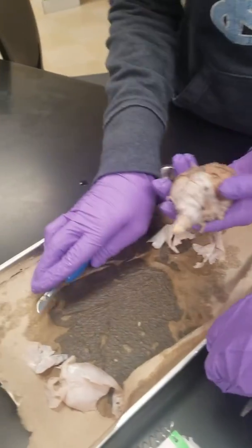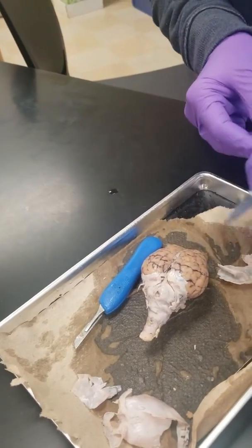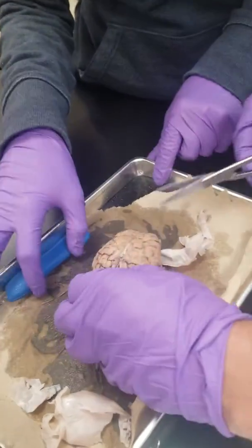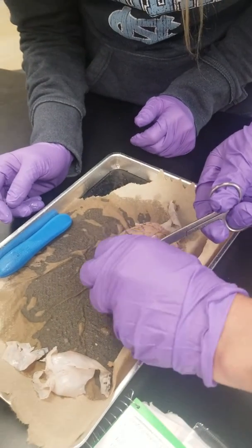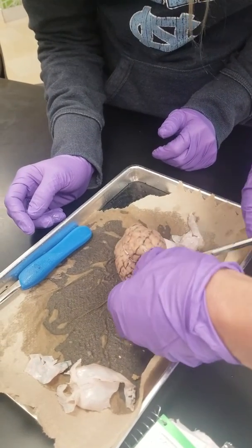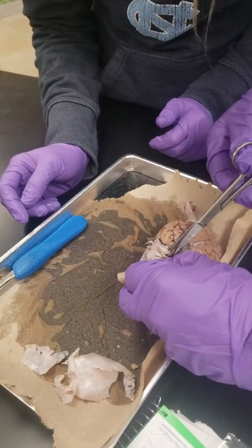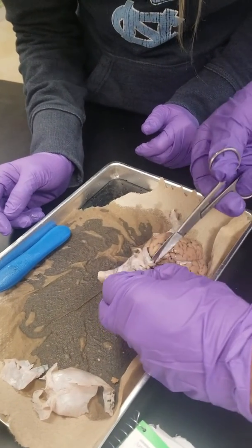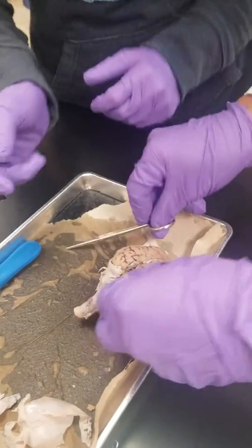Go ahead and use this one and try to keep it on here so you don't have to clean up as much. See how I said pay attention to how it dips in there? See how it actually dips in between here and the cerebellum as well? You can just keep making these cuts carefully, peel that guy like that, and then you'll cut that midline and then you can start peeling it that way.